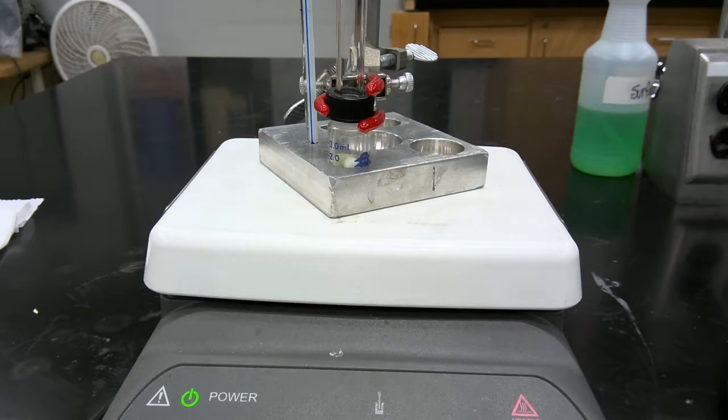This will facilitate ring closure and allow us to generate the desired N-phenylmaleimide with the loss of water. The acetic anhydride both serves as an activating group to encourage the loss of water, and it's also a desiccating group. The reason this reaction is run at elevated temperatures is also to assist in the ring closing process and help drive off some of the excess water generated. So we'll heat this reaction mixture for 30 minutes, and then we'll resume once the reaction is complete.